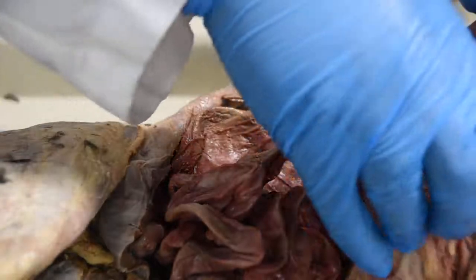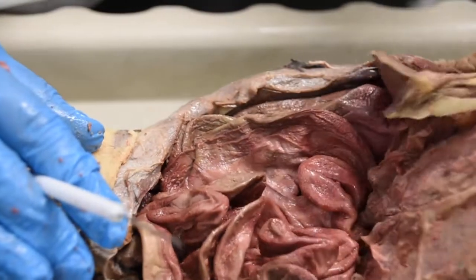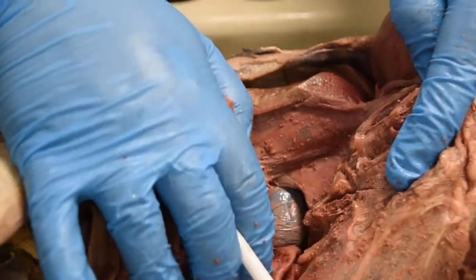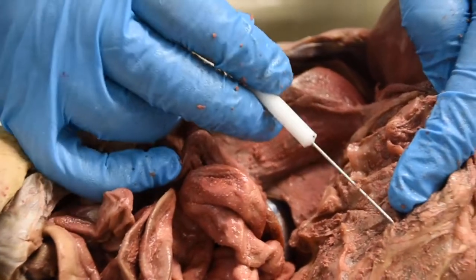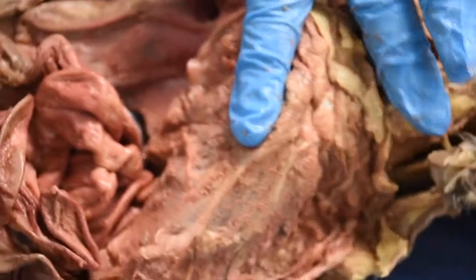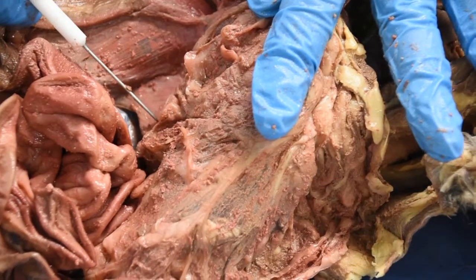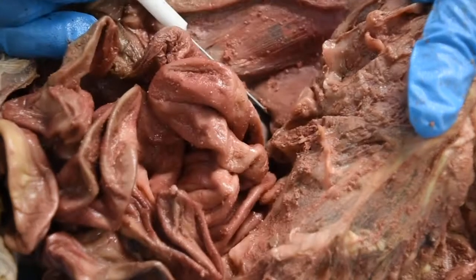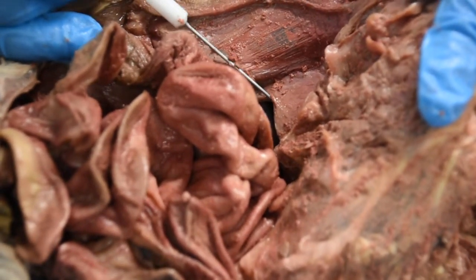Now, moving back up a little bit, we're going to try to find our pancreas. Again, here's my greater omentum. We're looking underneath the stomach right now. I don't know how visible it is to you guys, but we have an organ right here. What I'm holding with my finger is your stomach. I'm pushing back on the stomach, looking underneath it. This organ right here underneath the stomach, hidden by your stomach, would be your pancreas, which produces the majority of your pancreatic juices that help with the digestion of your food.